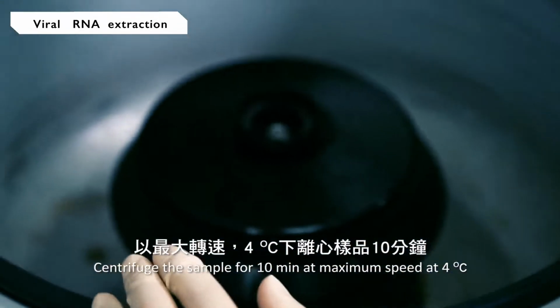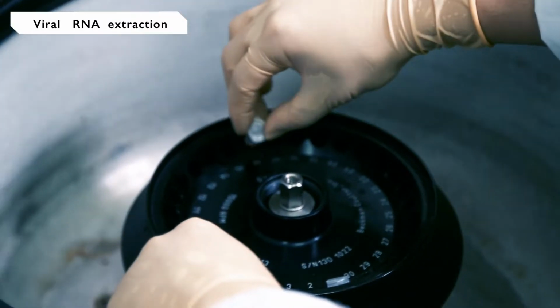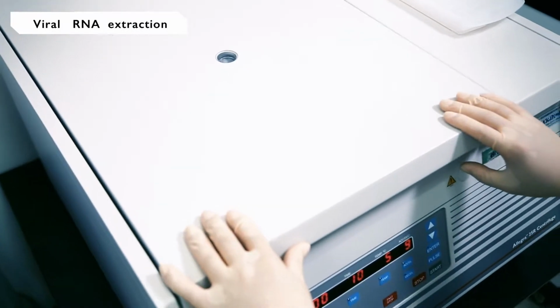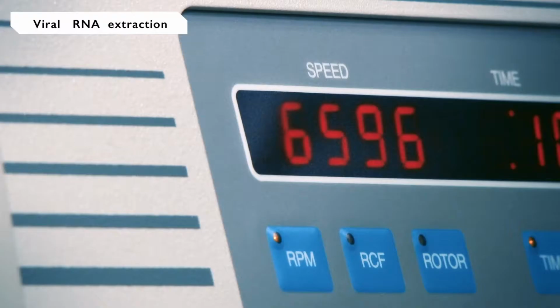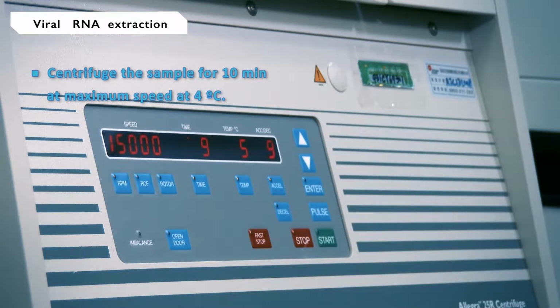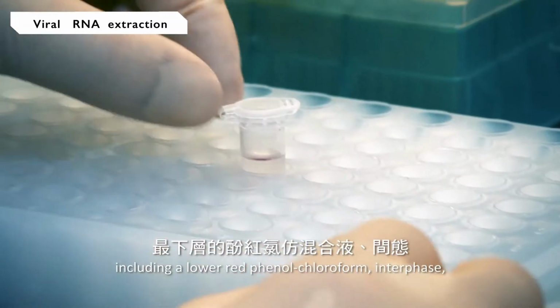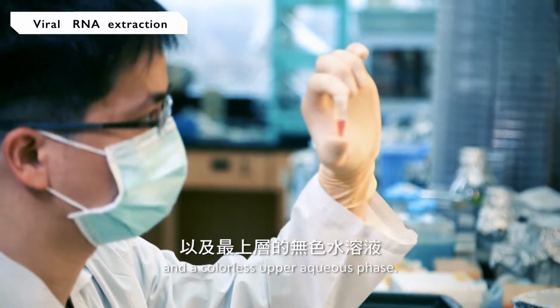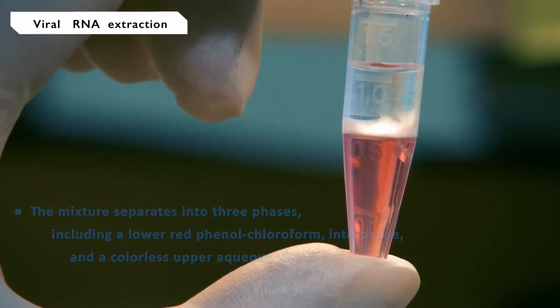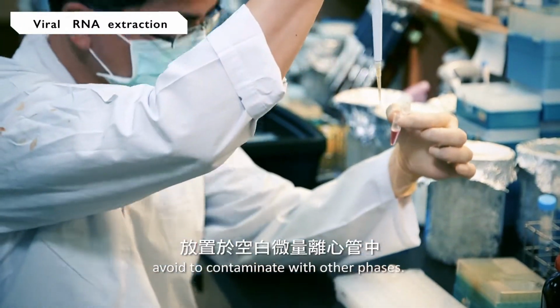Centrifuge the sample for 10 minutes at maximum speed at 4 degrees Celsius. After centrifugation, the mixture separates into 3 phases, including a lower red phenol-chloroform phase, an interphase, and a colorless upper aqueous phase. Extract and transfer the upper aqueous phase to a new microcentrifuge tube carefully. Avoid contaminating it with other phases.